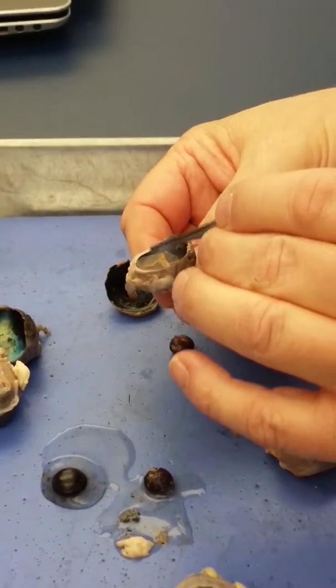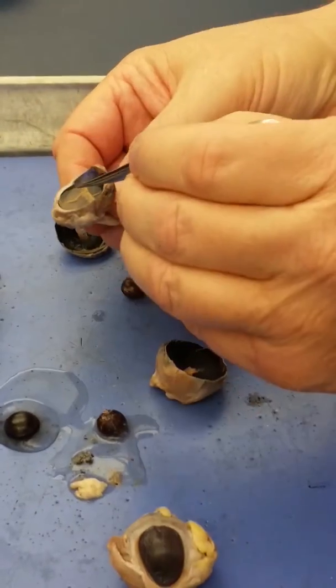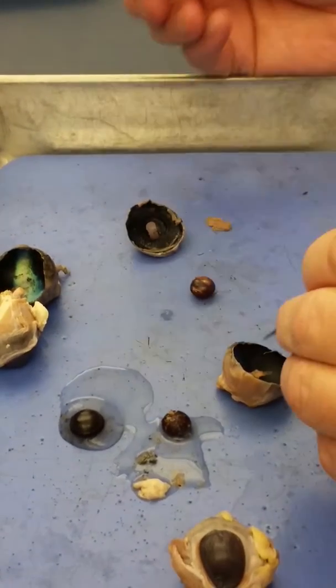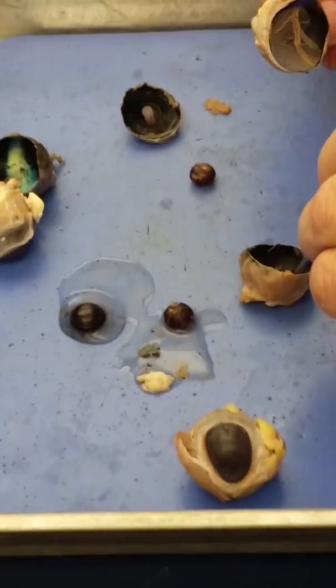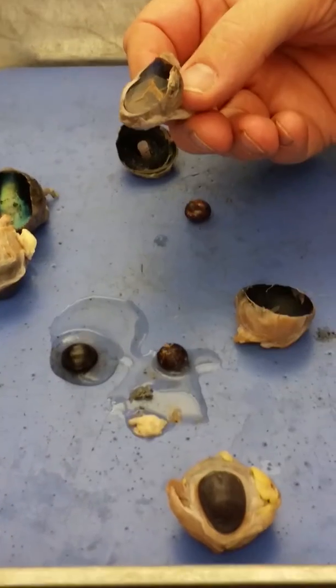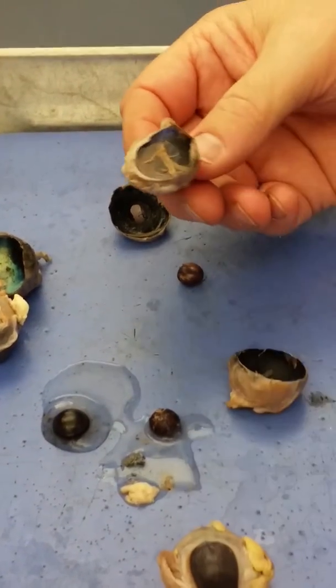But at any rate, on the inside of the posterior cavity in here is this film, which is the business of the eye. This is the retina. The retina is attached. You can see, I can even pick it up here. See where it's attached right here. And on this one, you see where it's puckered. It's attached right there. That's the blind spot that leads to the optic nerve.